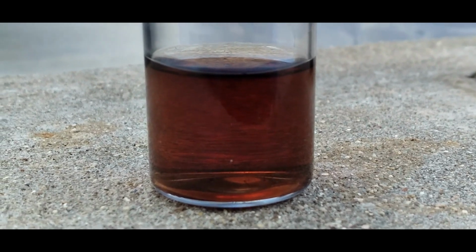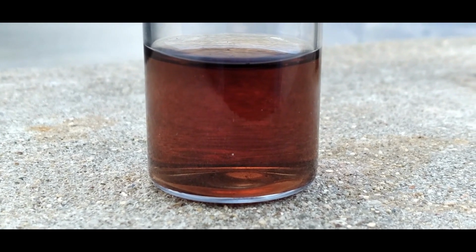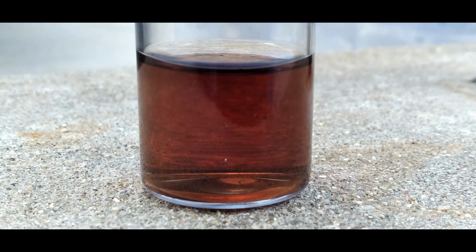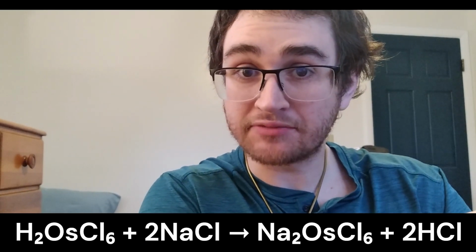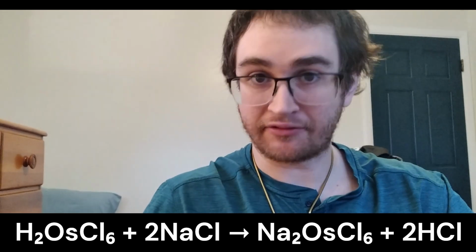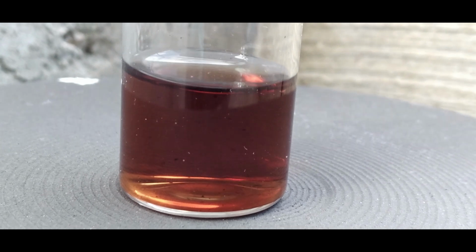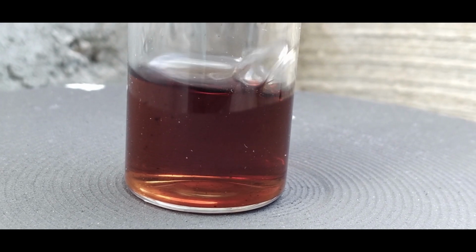Because technically this is chloroosmic acid, this is what I wanted to work with, and there may or may not be some sodium hexachloroosmate in there as well. So I decided to start boiling it down. You see, the issue is that there's already a bunch of sodium chloride in solution, and sodium hexachloroosmate is produced by the following reaction shown below on the screen. It stands to reason at this point there was sodium hexachloroosmate in solution.